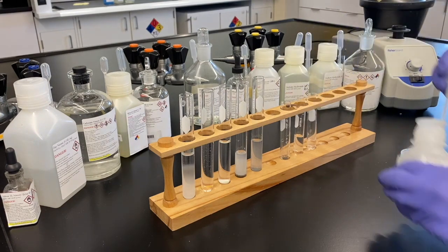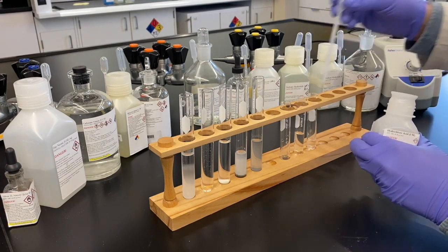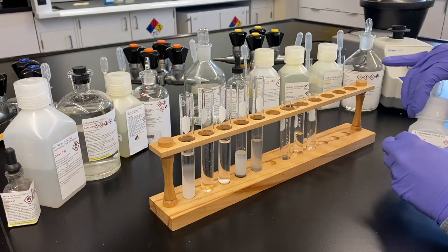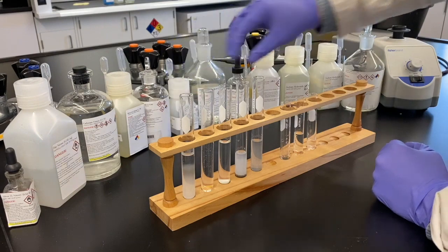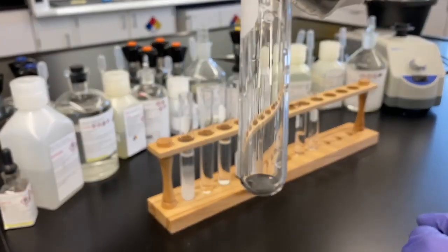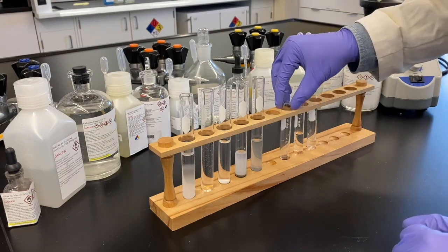So now we have a good chance. Yeah, 3 out of 4 chance. Stop the video right now and guess. But it's more complicated than that, right? It is more complicated than that. This is chemistry. Yeah. This is qualitative analysis.